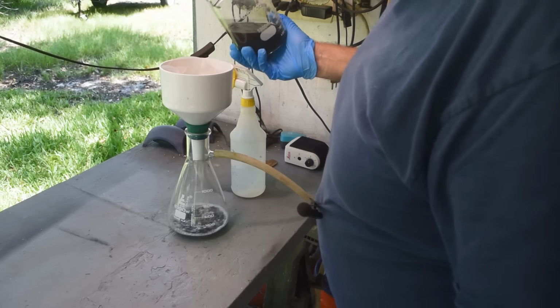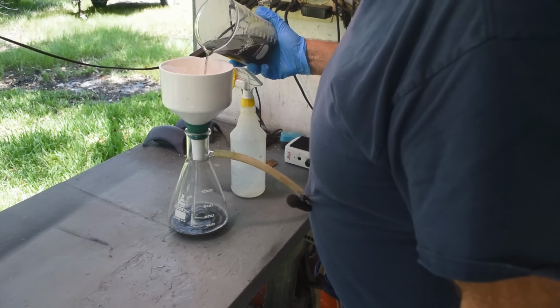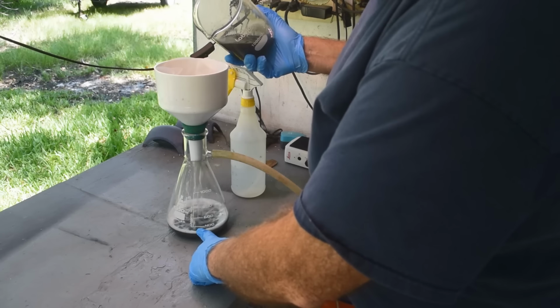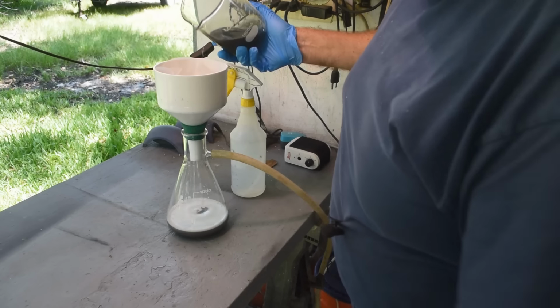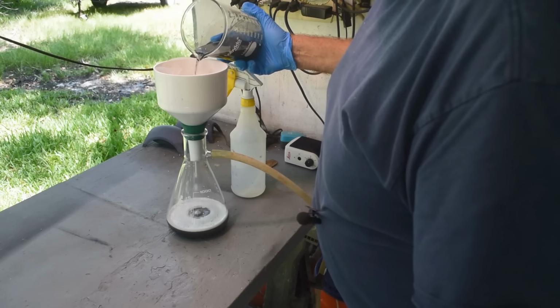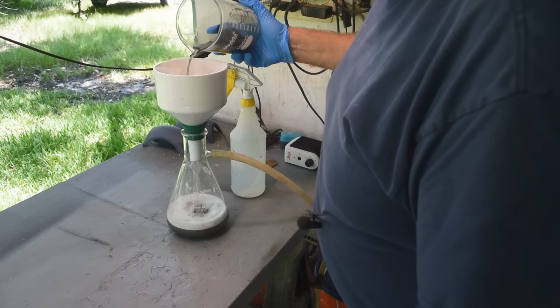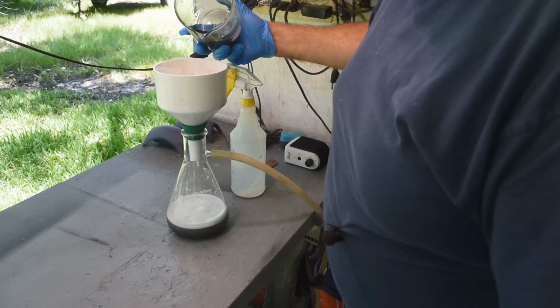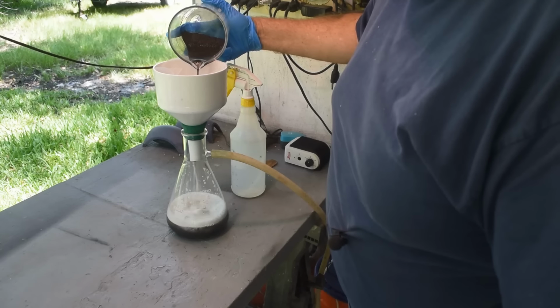Well, I would say some of it is coming through the filter, yes. Uber fine stuff that doesn't want to settle out is going right through the freaking filter. Look at that foaming. That's crazy. The ammonium formate must be doing that, or something the ammonium formate's broken down into. Formamide, maybe? I don't know. Causing the foaming.